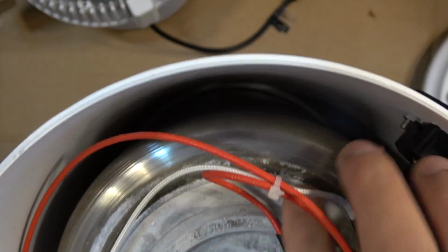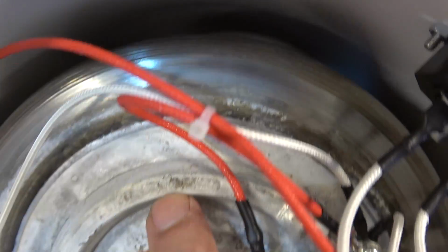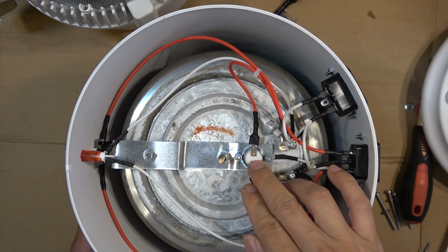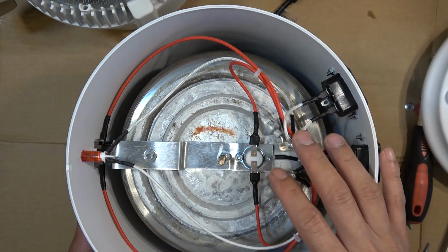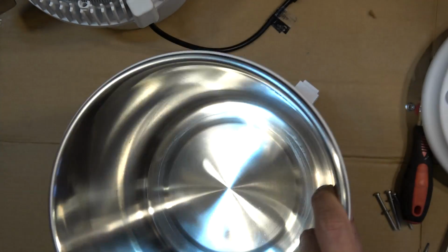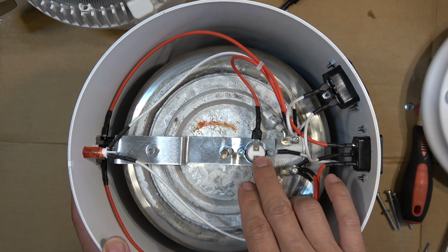The heating element, let me show you the label here, it says 120 volt, 750 watts. So the way this works is extremely simple. There's a heat sensor here. So when the pot is boiling the water, it stays at constant temperature until all the water is gone. Then the temperature will rise after the water is gone. So only when the water is gone, when the pot is dry, there's no water in it, then the temperature at the bottom will rise and the heat sensor will turn it off.